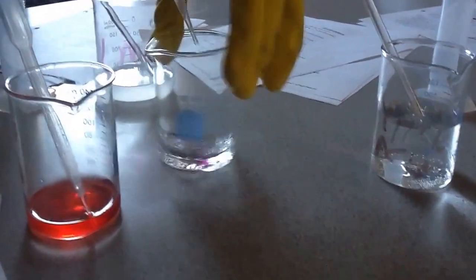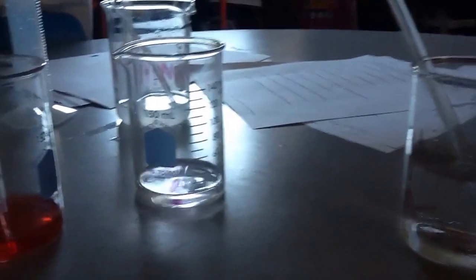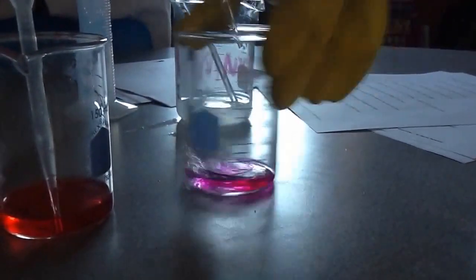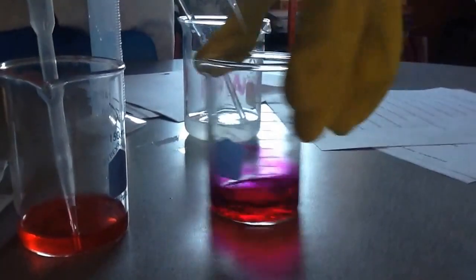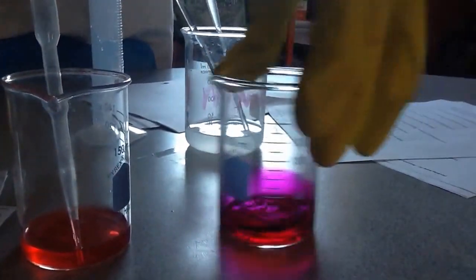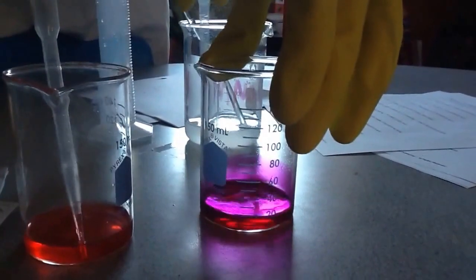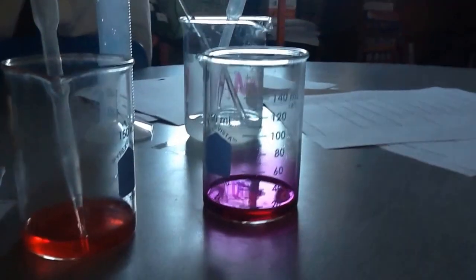The middle part's not quite getting it. And it looks like we just hit it. So I got it within about two, three drops worth. It's pretty accurate. All right.